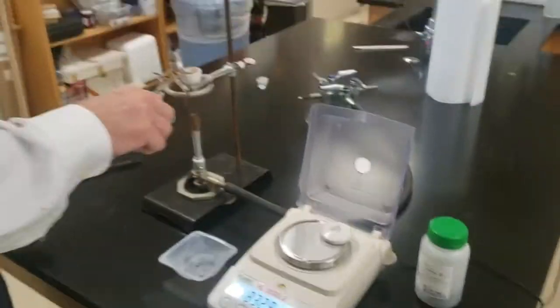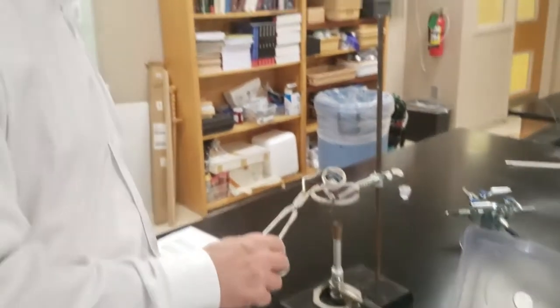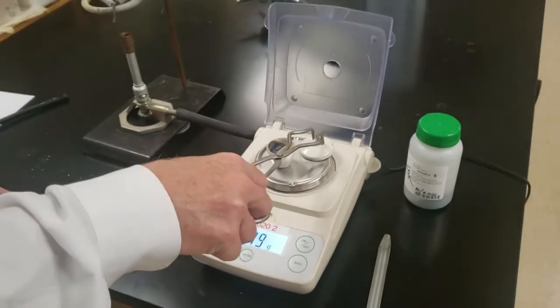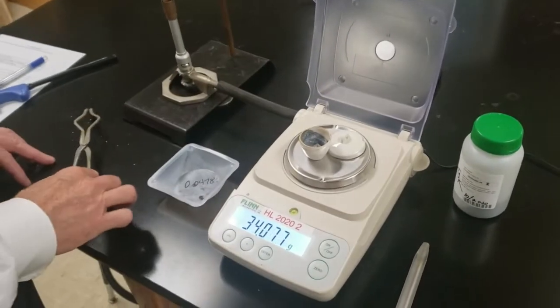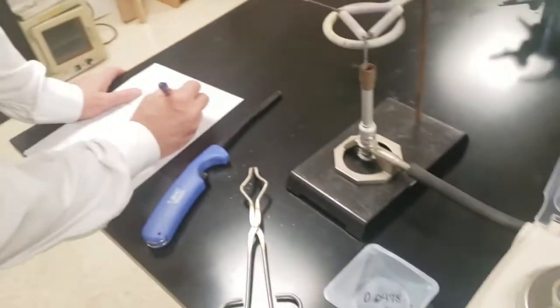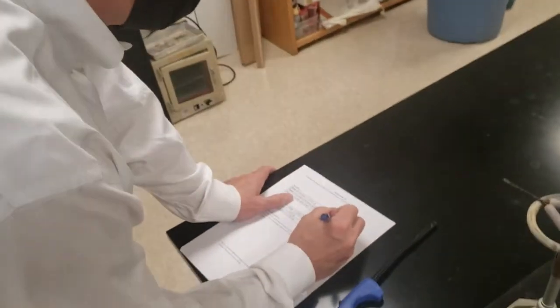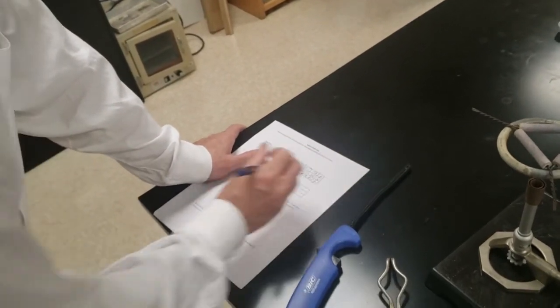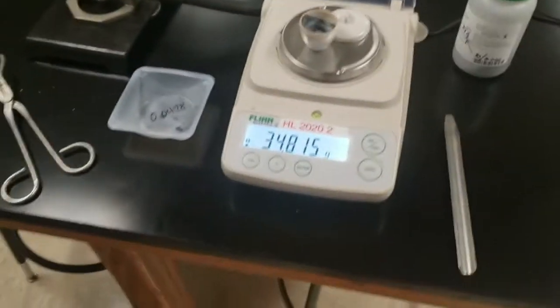Now when it's room temperature—not just, you know, not so bright red, but like room temperature—we're going to weigh it again. At this point, we should have driven off all of the oxygen. It should be just the silver with the crucible and the lid that's left. And now you've picked up your three numbers, and for your lab itself, it is over.